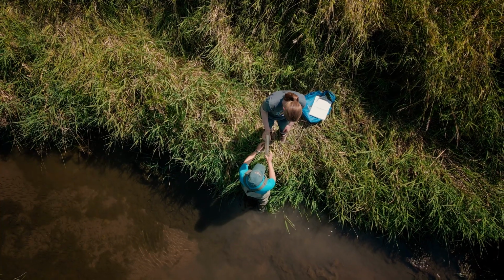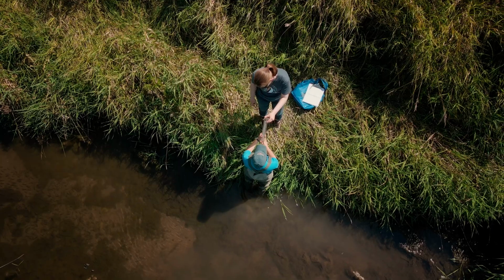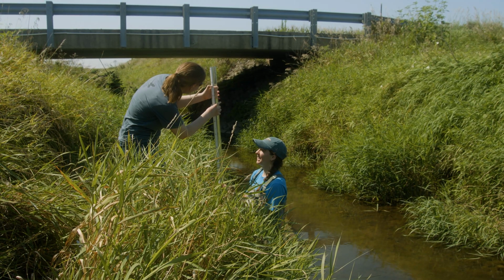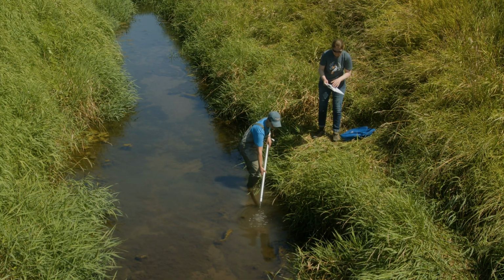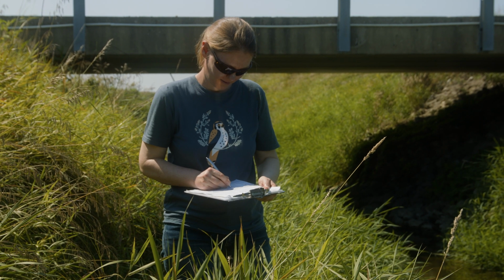This may be easier to do on land or at the stream edge. You can move wherever you need for this measurement. Measure the amount of water remaining using the ruler on the side of the tube. Record the amount of water in the tube to the nearest centimeter on your data sheet.